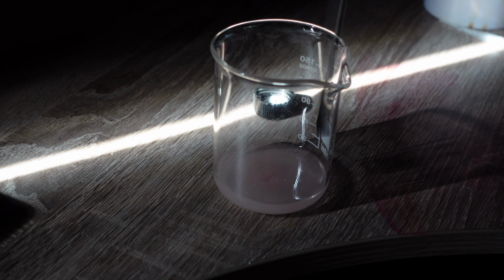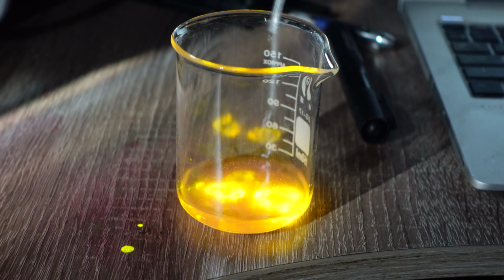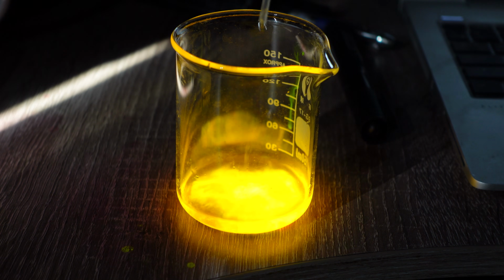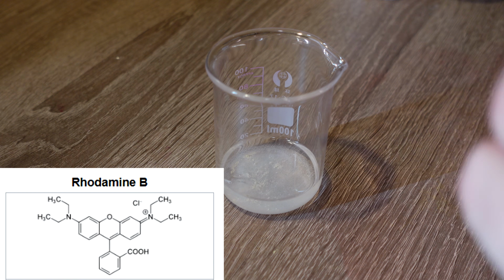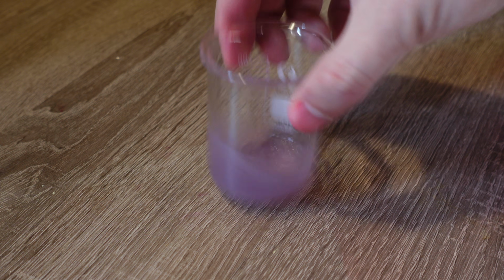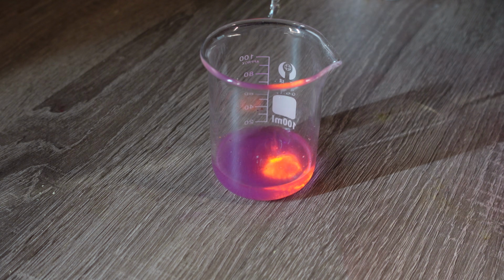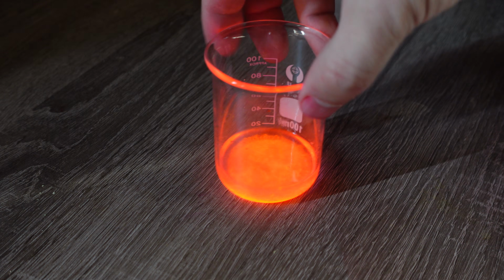After this, I turn off the lights and add a couple of milliliters of 30% hydrogen peroxide, and the reaction begins. The luminescence is very bright. You can even see that the brightness is higher than that of a surface illuminated by the sun. I tried this reaction with another dye, Rhodamine B. About 8 years ago, I did this same reaction with 15 grams of dinitrophenyl oxalate. It was epic. The luminescence with Rhodamine B was red, but the brightness was much lower.